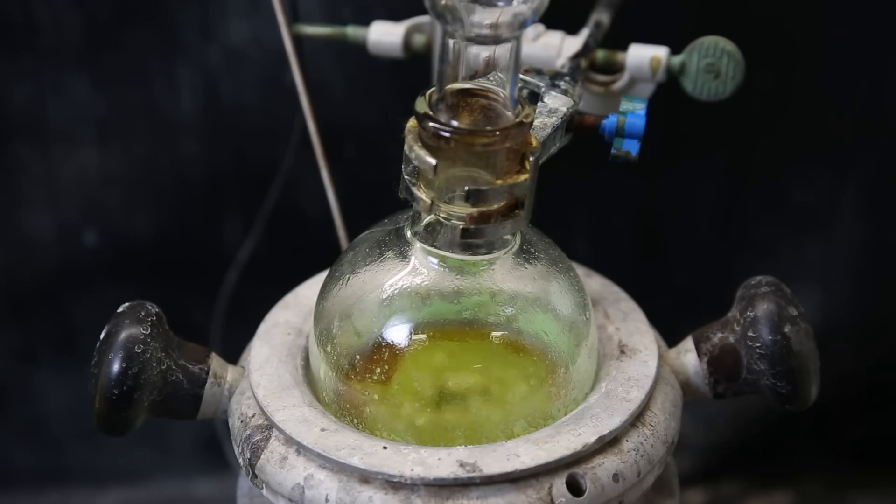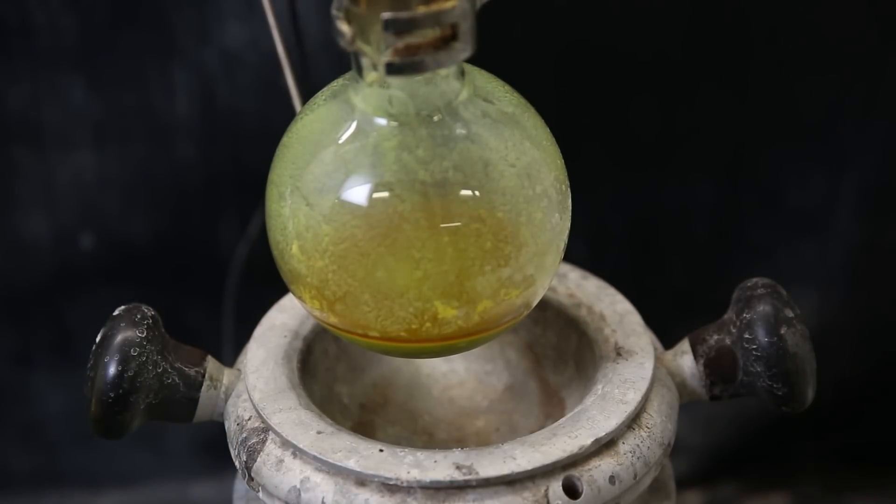When I return the next day, we see some green uranium tetrachloride has appeared, and the mixture is refluxing normally. Ideally, some effort should be made to shake the flask and get everything to come loose, since some unreacted material can stick to the sides of the glass while being covered in uranium tetrachloride. Stronger stirring can also be helpful. This time, it looks like it contains a tiny amount of unreacted uranyl nitrate, since there are some small yellow spots, but it should be very little.